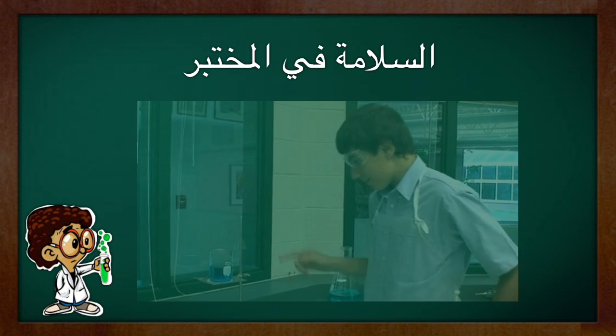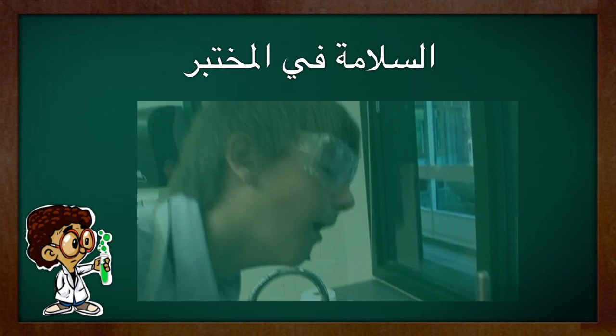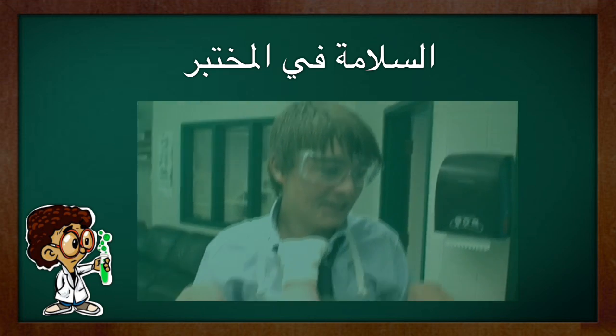Okay, Mitchell, smell this and tell me if you think it's ready. Brandon, I don't feel so good. Does this look okay to you?